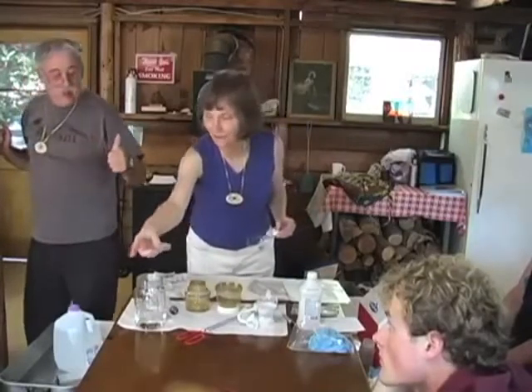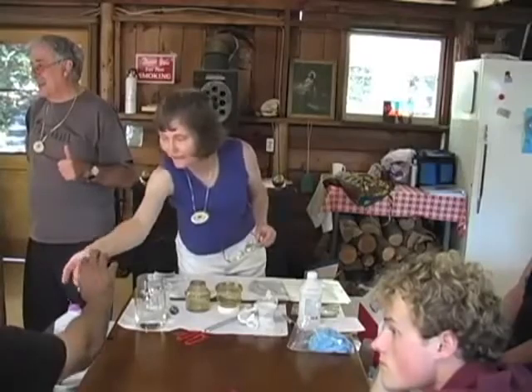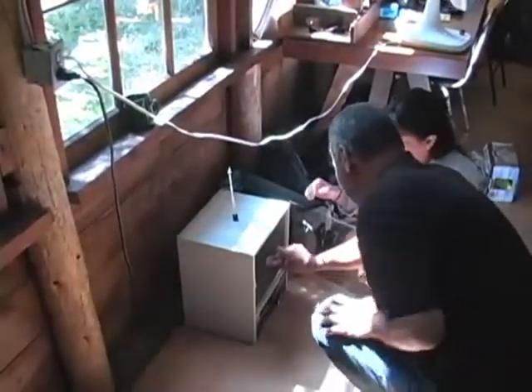Show what happens when a thumbprint shows up in a water bottle. Hold it like this and put it in the oven. And the reason we want to do that is we're going to run water through it, and we're going to see what somebody had on their thumb and didn't know it. Okay, all this is going to get sterilized.